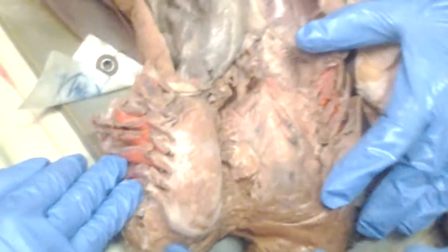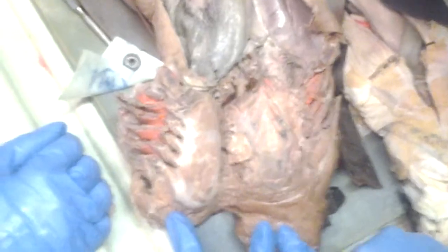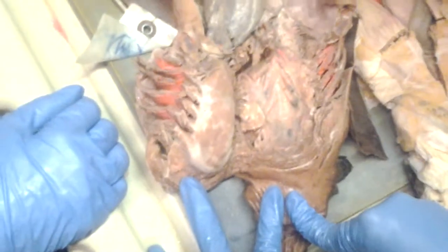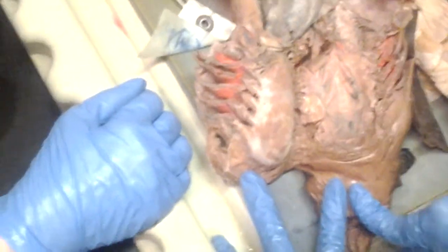Can you tell the difference between primary and secondary lamellae? That is a good question. Do you need to know that for your exam? No. I was scared. The dots that you see would just be primary, like the more visible ones. We don't need to know that, right? I don't think you do. Let me see. Can I see this, please? That's okay, no problem. Primary and secondary lamellae. Okay, here's the part about that.